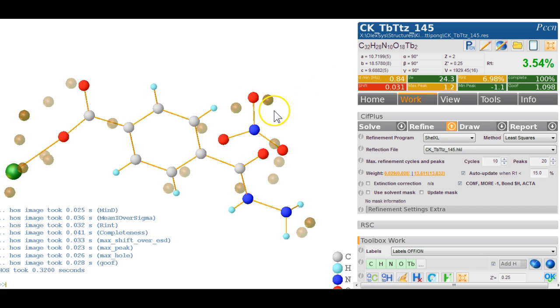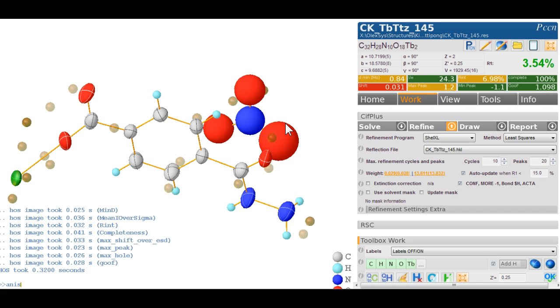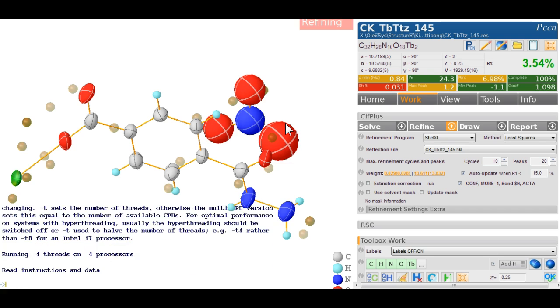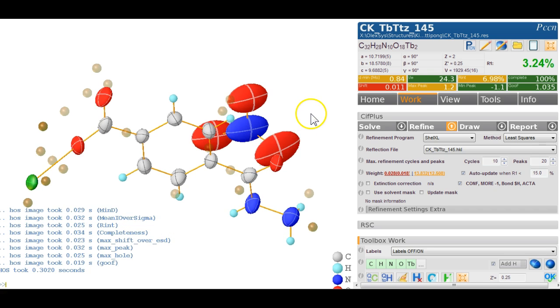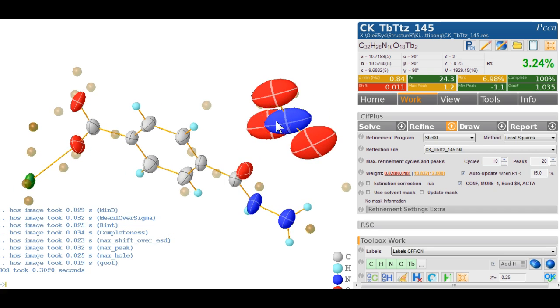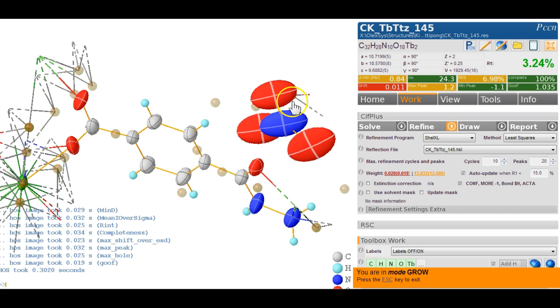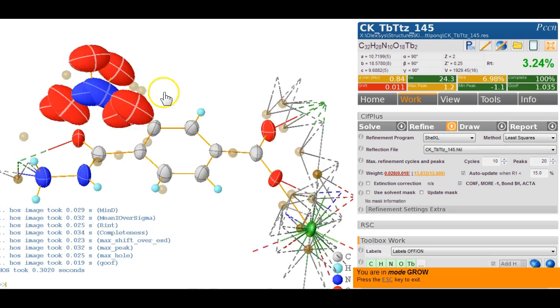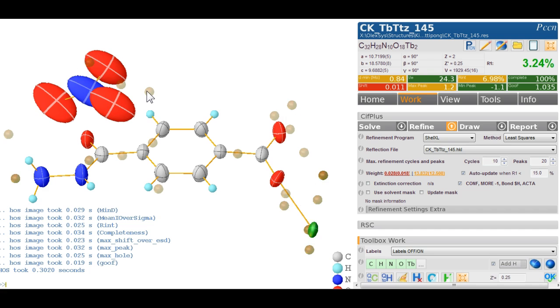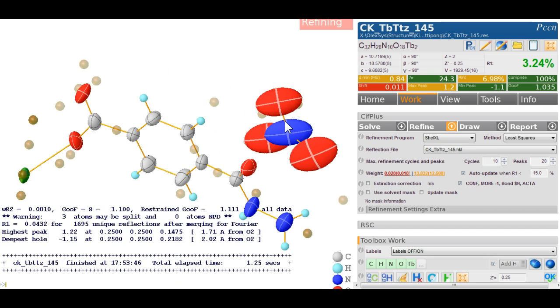It's not surprisingly in here, so we look at the Tb. What we've got here, we go anis on this, allow it to be anisotropic, and refine. Doesn't look particularly great, but then you can't really expect that to behave very well, because if you grow this, you can see that this is sort of all on top of each other, so there's a lot of correlations going on.